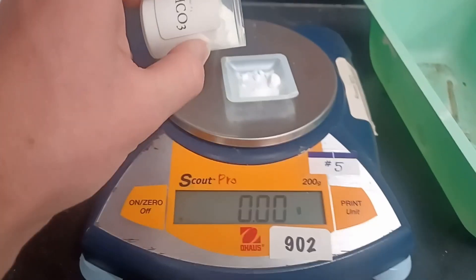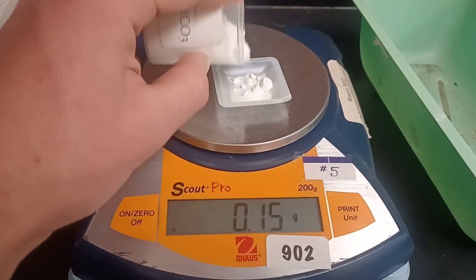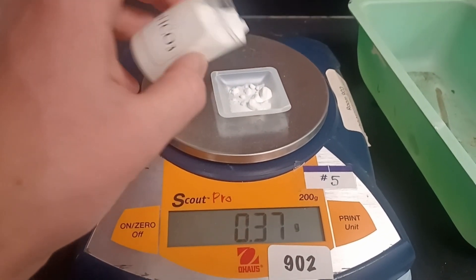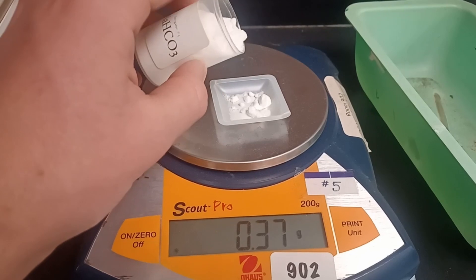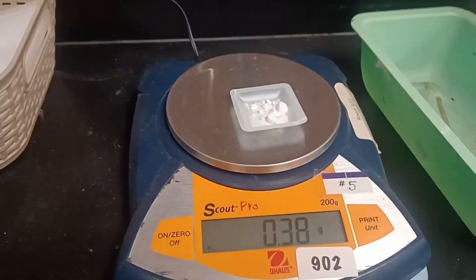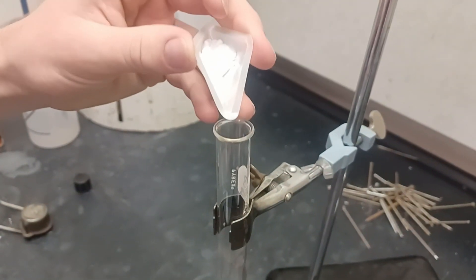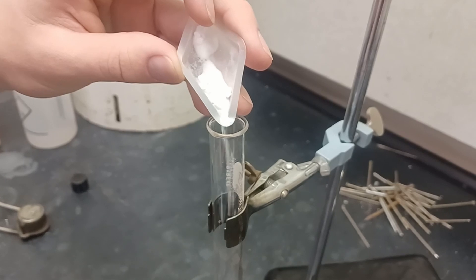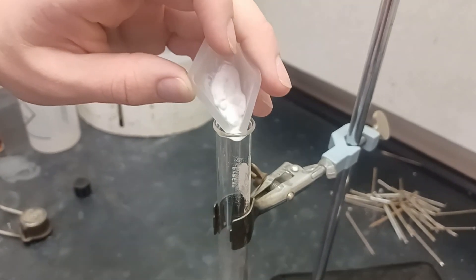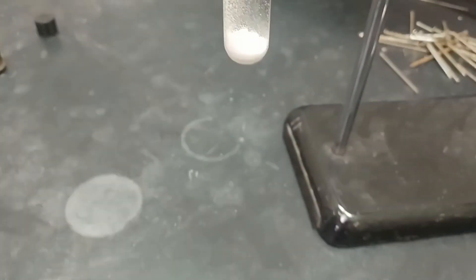A mass 50% of that of the lysine used in sodium bicarbonate is weighed on a scale. The mixture is then added to a test tube mounted to a ring stand. It is important to ensure the two compounds are mixed thoroughly in order to ensure the proper reaction takes place.